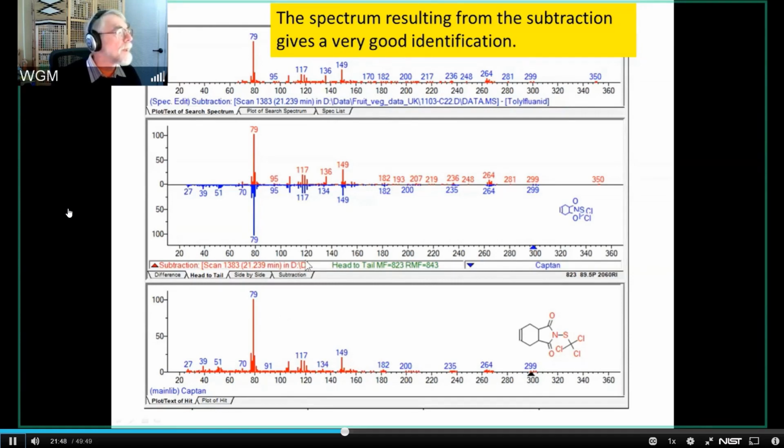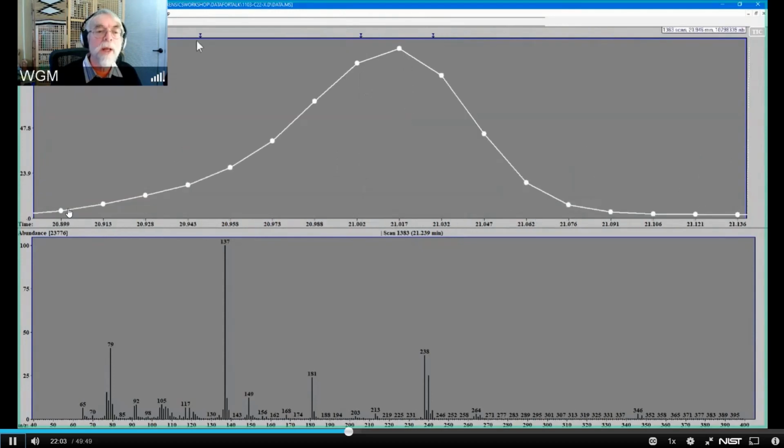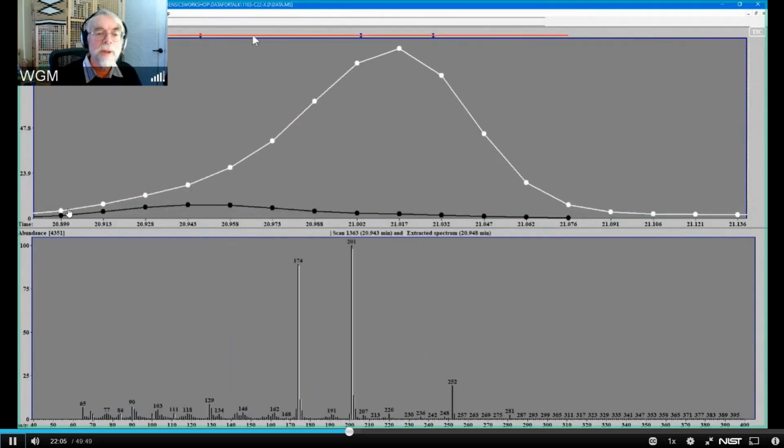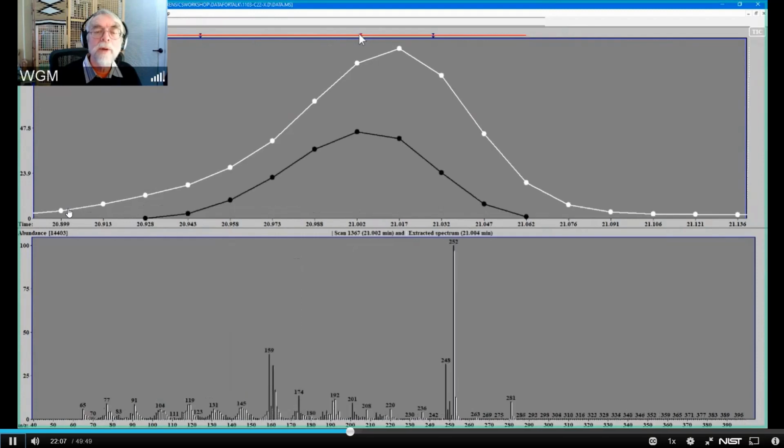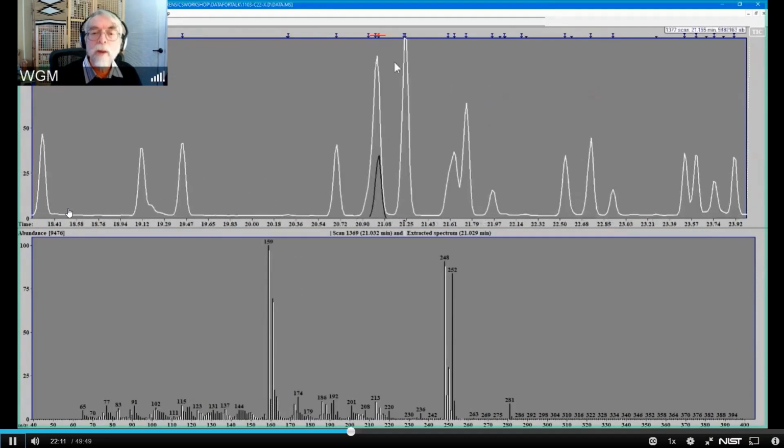And so let me go over to AMDIS. This is a piece of that chromatogram that I showed you before. If you'll remember, the very first thing we looked at is this little section in here that had these three components in it, that one, and then that one, and then that one. And now we're focusing on this one over here.